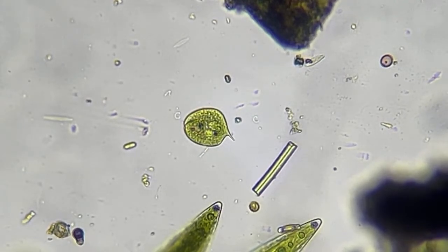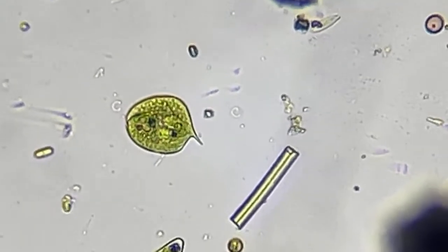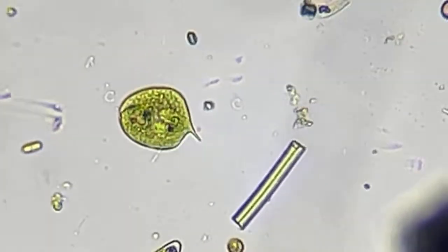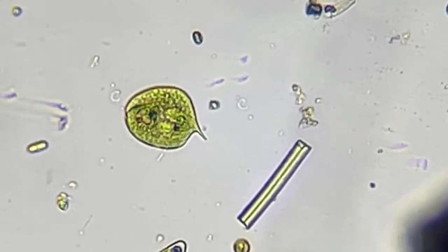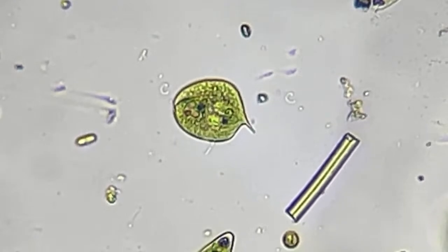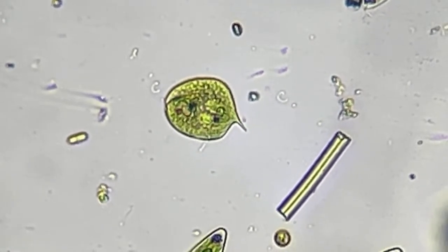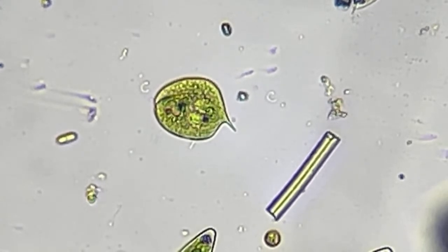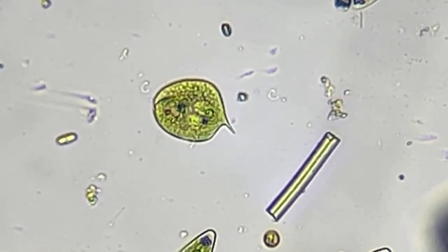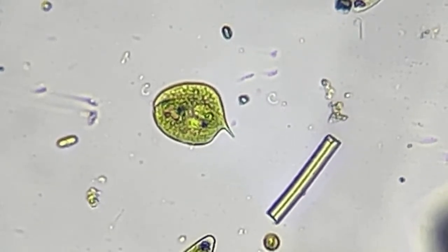That little bitty thing below the Euglena, well, you're getting a treat today. That's going below them. That's bacteria. And it looks like a bacteria that's dividing. And it doesn't look like Spirillum either, so that might be some kind of cyanobacteria. You could see some bacteria with 200, 400x, but not too many.